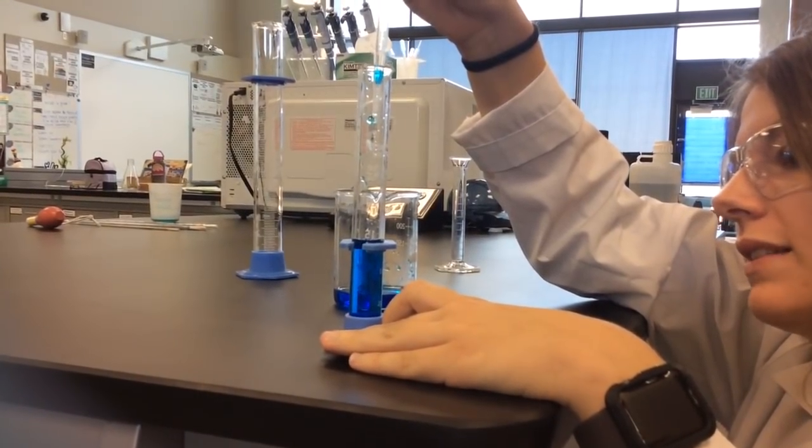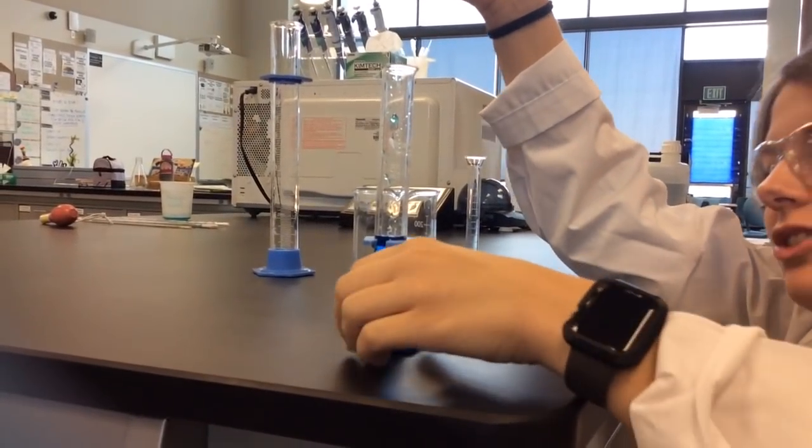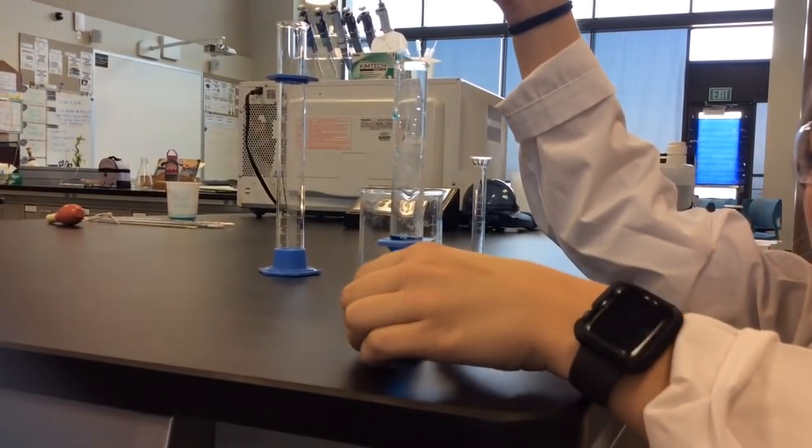And a couple more drops because that's like the top of it. And it's a very slow process, just to make sure that you guys have it correctly.